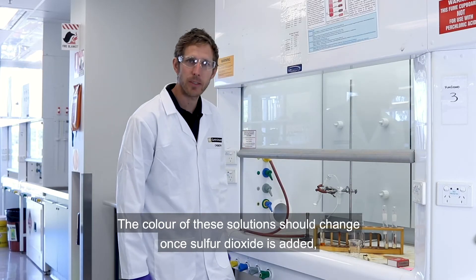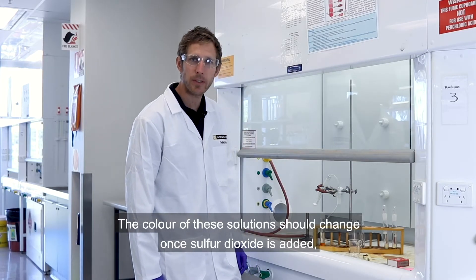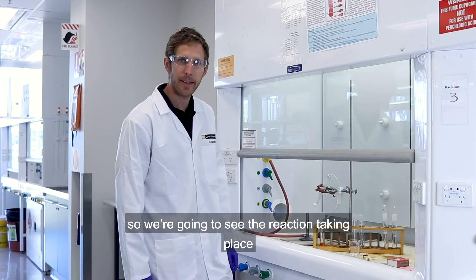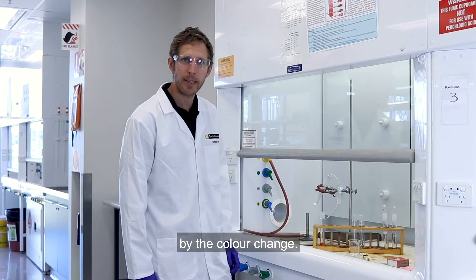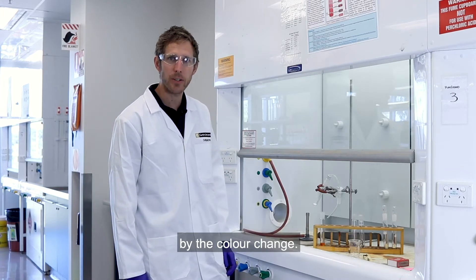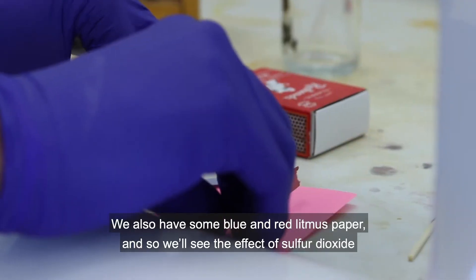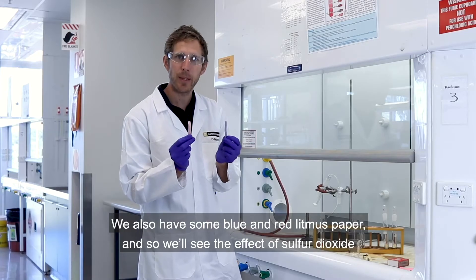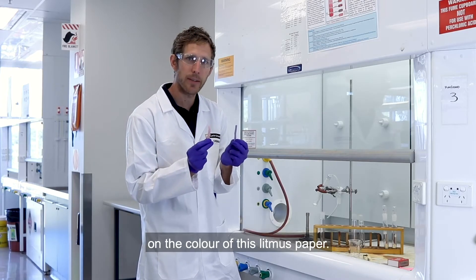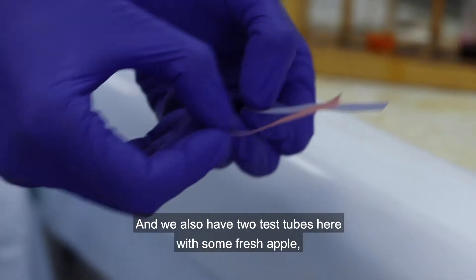The color of these solutions should change once sulfur dioxide is added, so we're able to see the reaction taking place by the color change. We also have some blue and red litmus paper, so we'll see the effect of sulfur dioxide on the color of this litmus paper.